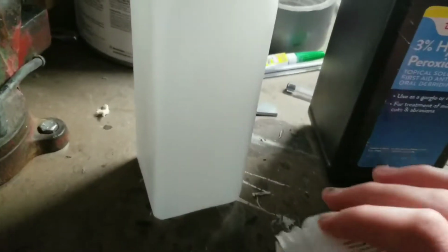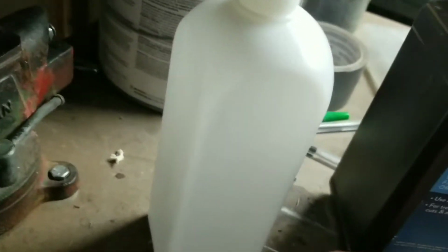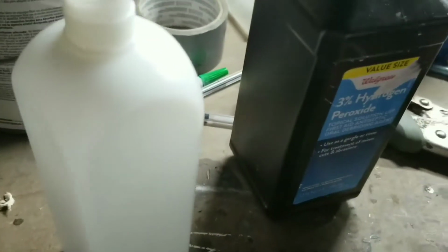Now, first thing first, if you're going to want to build a double cell electrolysis rig instead of a single cell, for whatever reason, possibly to collect the hydrogen on its own, because I want to start an element collection series where I collect all the elements on the periodic table in a pure form and start an element collection to show it off and stuff. It's pretty cool.